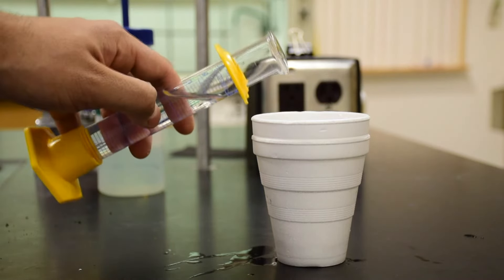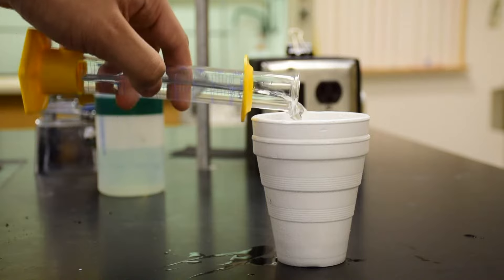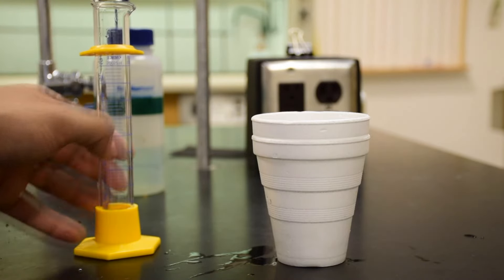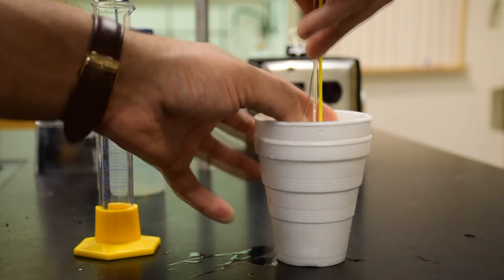You want to make sure that the amount of water submerges the bottom of the thermometer. You also want to make sure that the bottom of the thermometer is not touching the bottom of the cup. Record this volume.